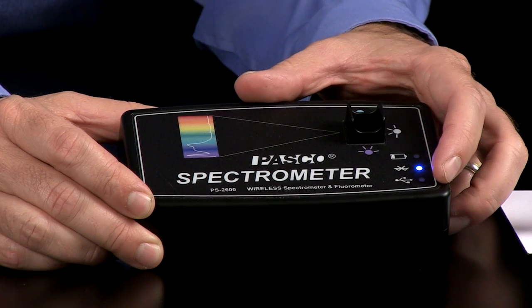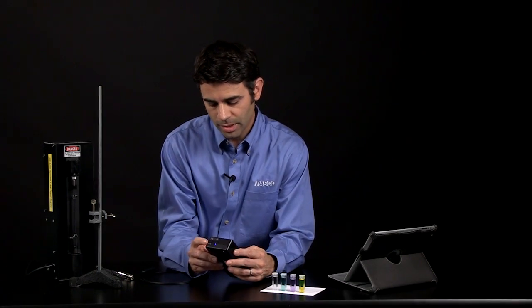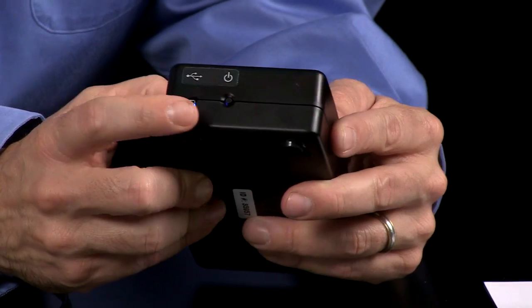It can work via USB, via Bluetooth, and there's a power indicator. On the side, there's a USB port and a power button.